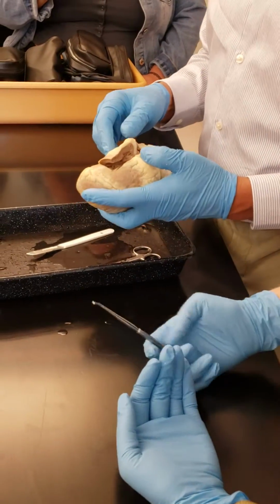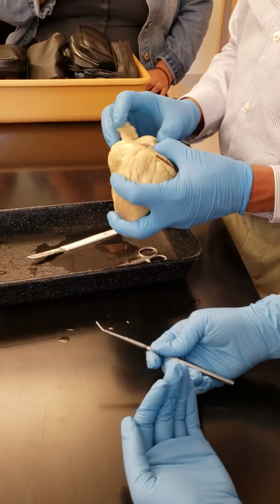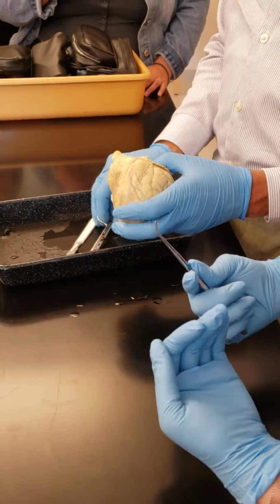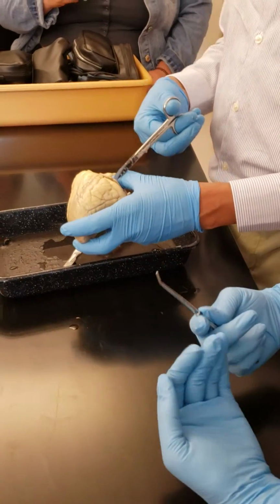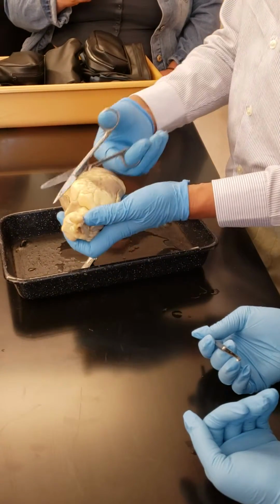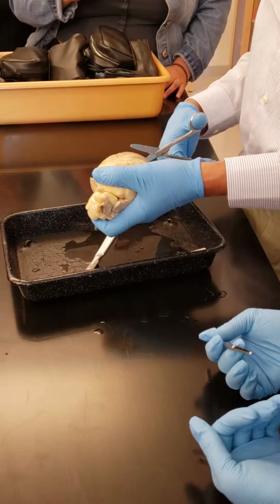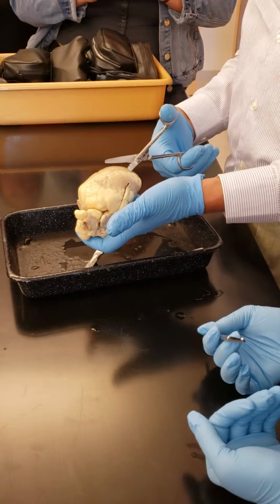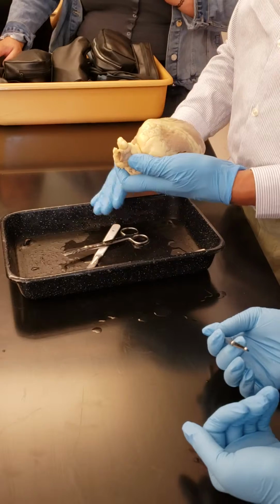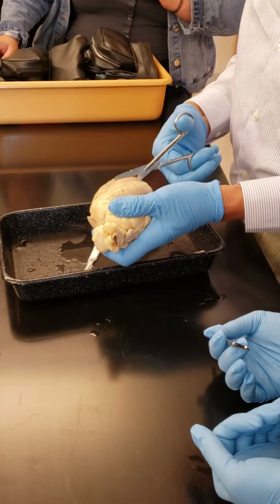Now, what I want to do is give a cut on this side, and which valve will be there then? Bicuspid. I want to go parallel to this, right? Not like this, parallel to this. This is an easier way to do dissection. All other groups don't follow this procedure. It's more technical. Otherwise, you can just give a cut like this, cut it in half. But this is more methodical.